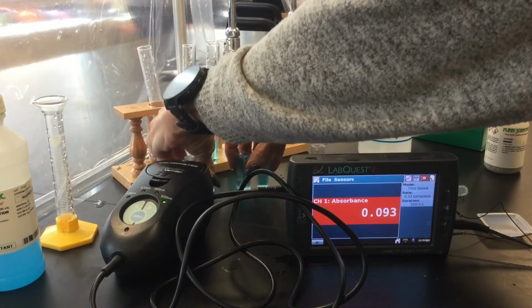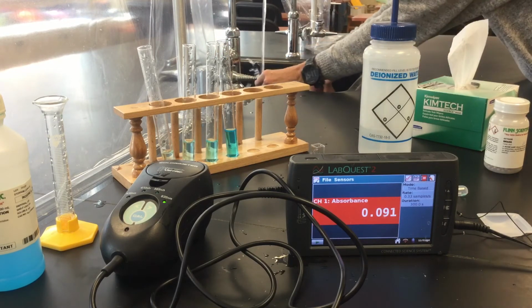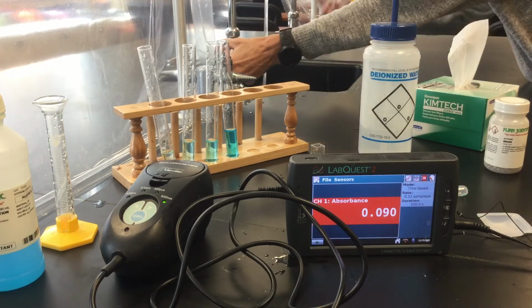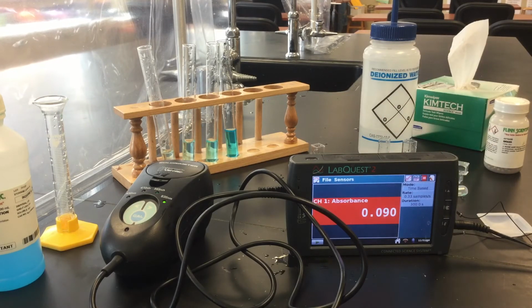Let me clean these up while you're recording those numbers. You'll plot the absorbance versus the concentration to get a Beer's Law curve, and then we're going to do the same thing with the copper solution from the BBs. That should fall somewhere on that curve. Remember, when you're doing your graph, make it big. Use your graph paper and axes so you get a nice, large, easy to read graph. It'll make it easier to plot where the copper(II) nitrate from the BBs falls.